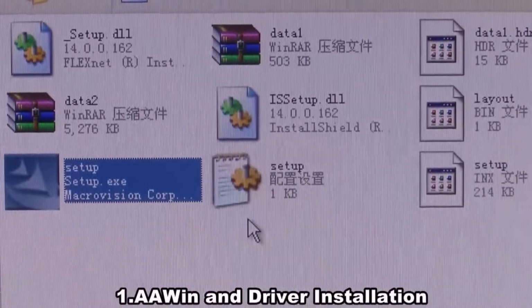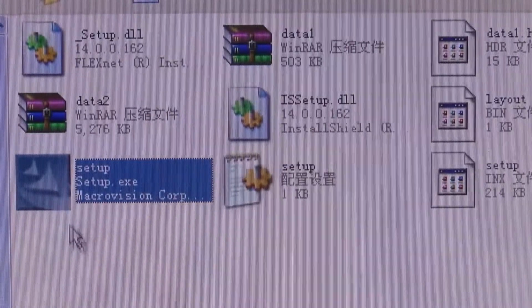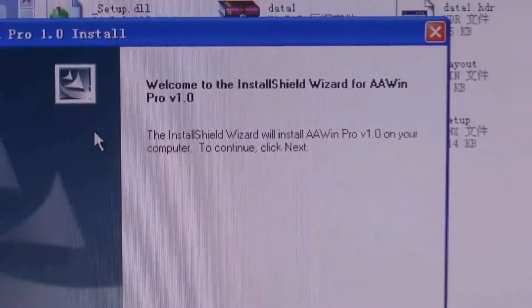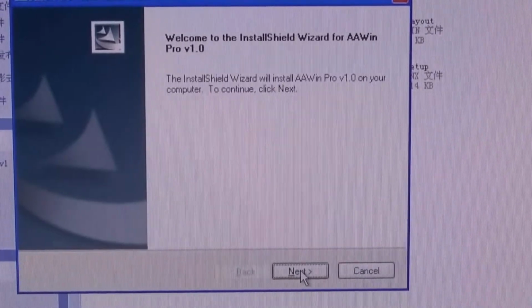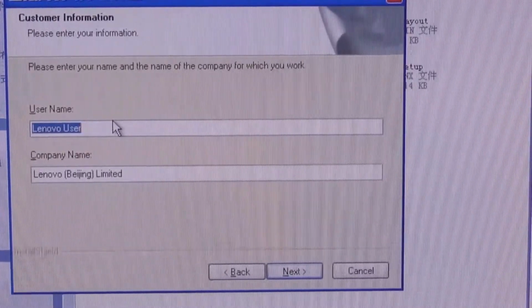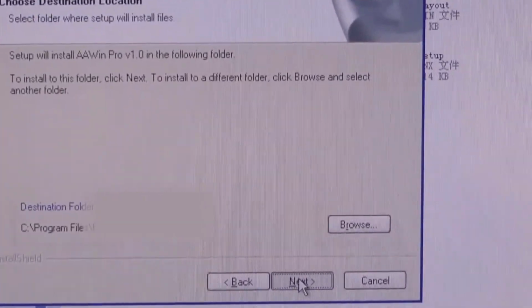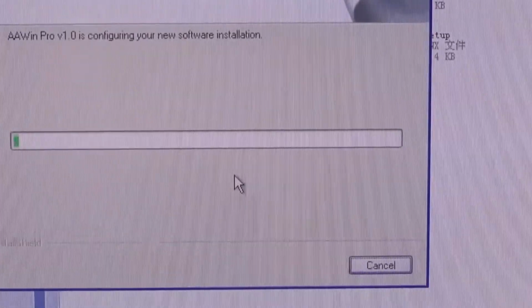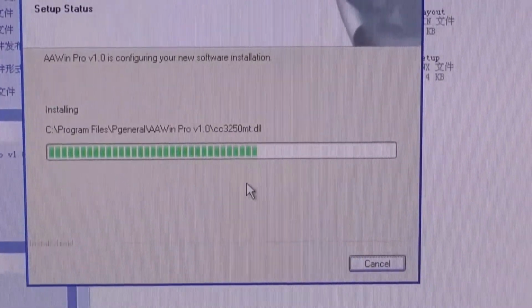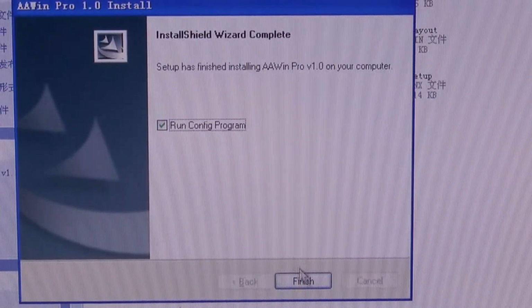To install the software, put the software disk into the computer and open the file. Double-click on Setup. Click Next. Here you can input your username and company name, and then press Next. Choose where you want to install the software and click on Next. Tick Run Program and then press Finish.